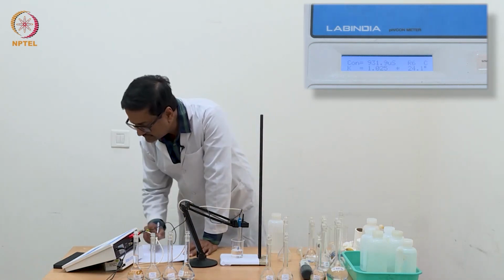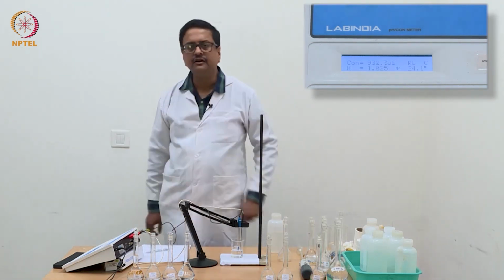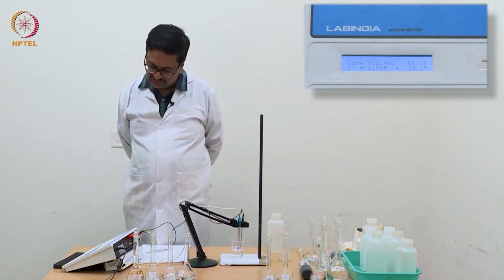So now you see the number has jumped to 932 and it is still increasing. We need to wait for a while for the meter to stabilize.